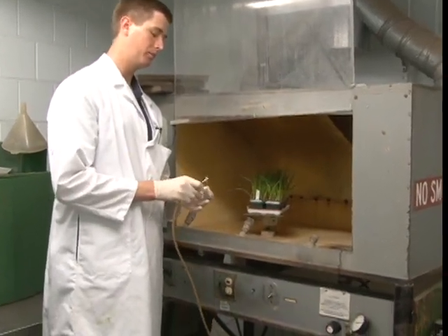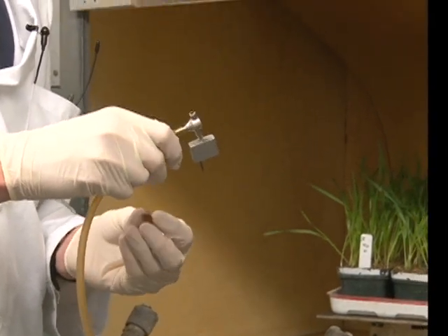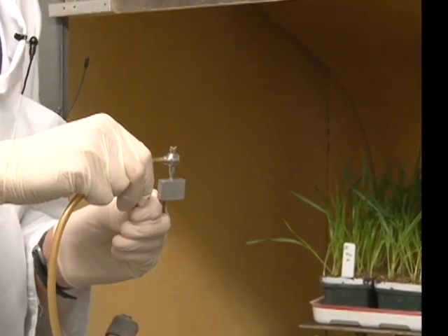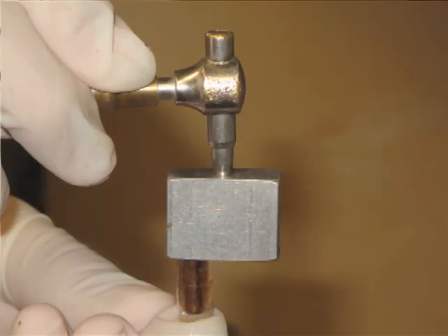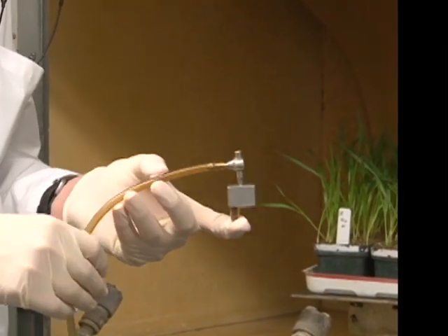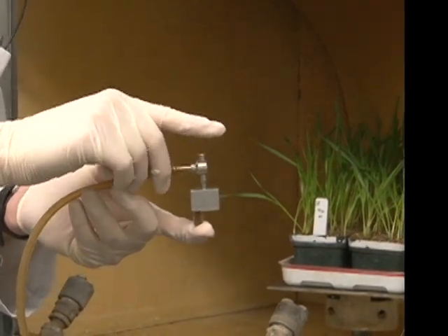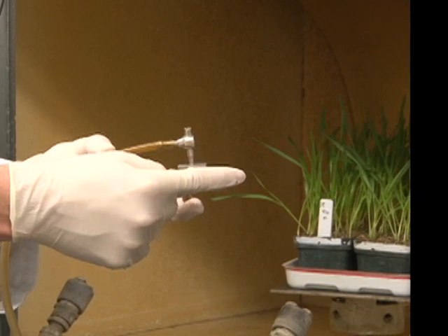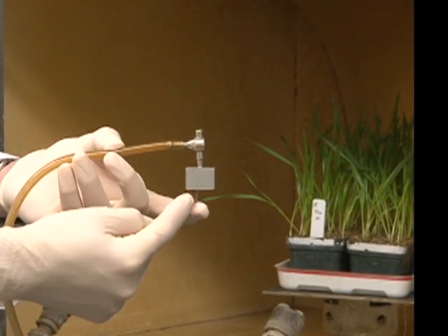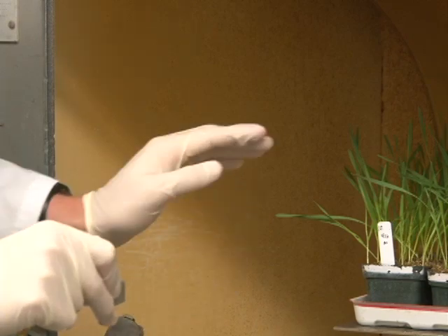When we take this tube and attach an inoculator to it — an inoculator is similar to a collector — and also attach a capsule that has oil and spores below the inoculator, we have an apparatus that can be used to inoculate plants. Normally the vacuum blows air out of this tube, and the air would come out of the top. If we place our finger on the top of the apparatus, the air will then blow out the side of the inoculator, and spores and oil will be drawn through and sprayed out of the inoculator.